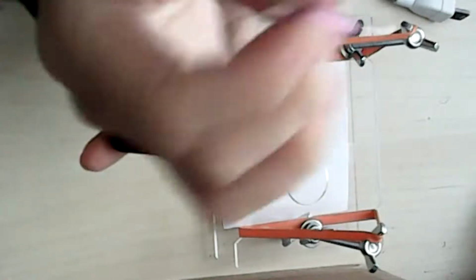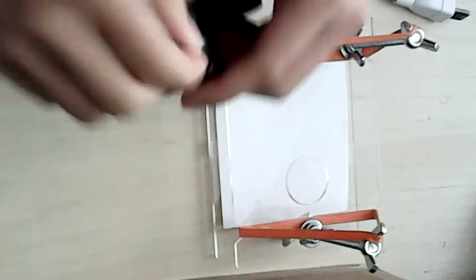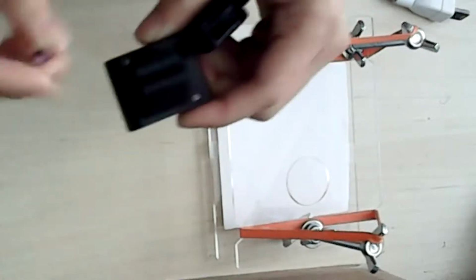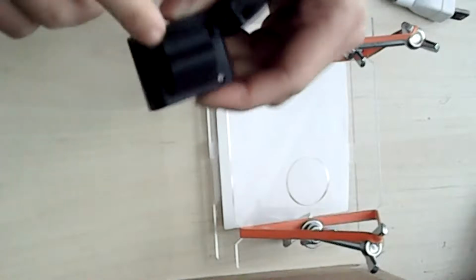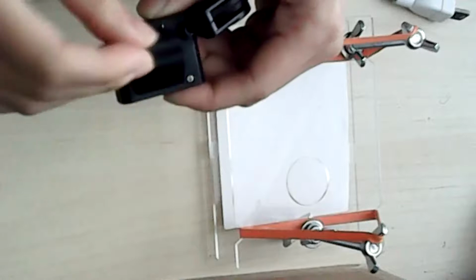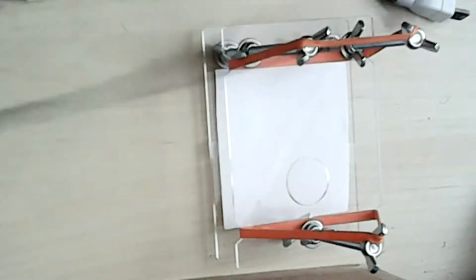So two sides, pick the plus side. And then depending on what kind of webcam you get, you might have 4, but this one has 2 screws. And I find it easier if you open it up, so this part is not in the way.